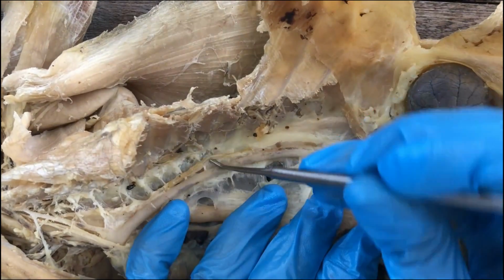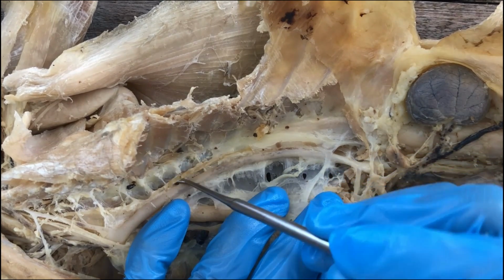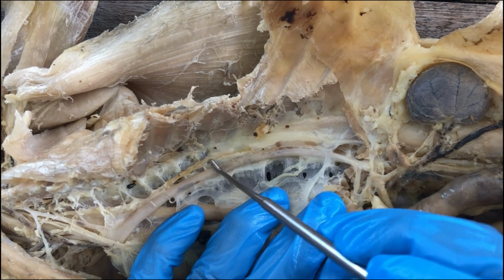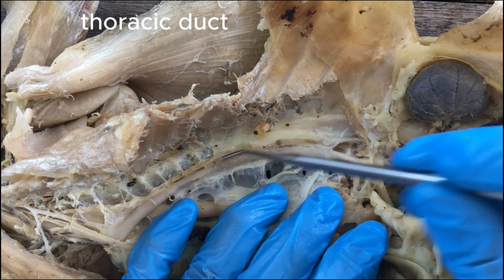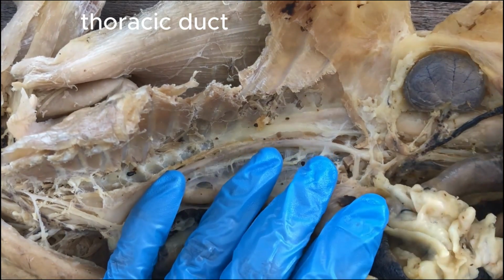And by the way, you see this brown vessel-like structure? That's not actually a blood vessel running alongside the thoracic aorta. That's a lymphatic duct. That's called the thoracic duct, and it's part of the lymphatic system. It actually collects lymphatic fluid from the abdominal viscera.